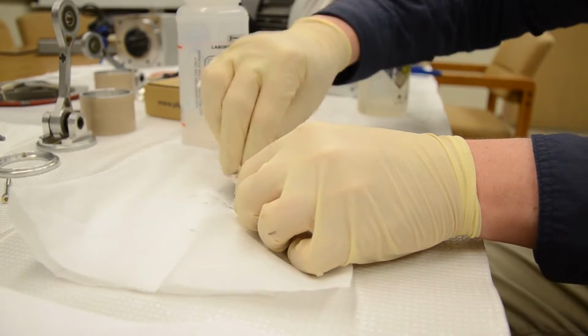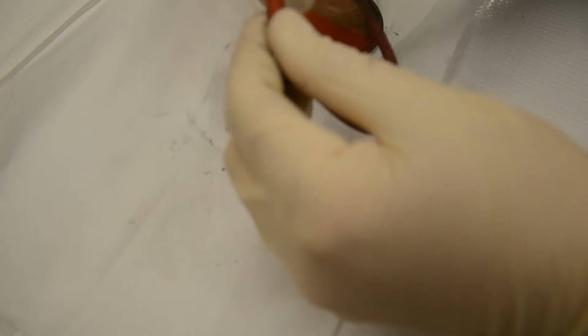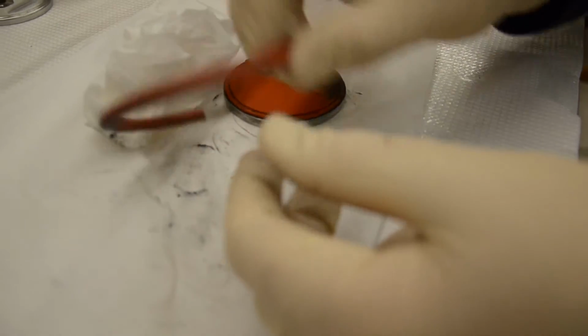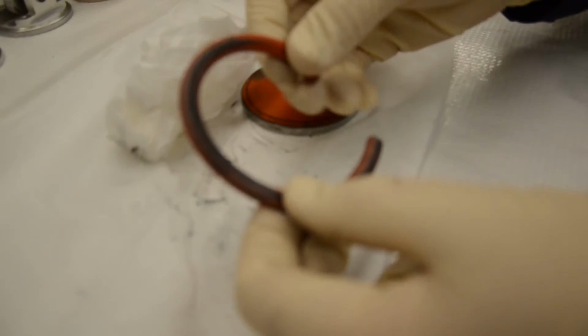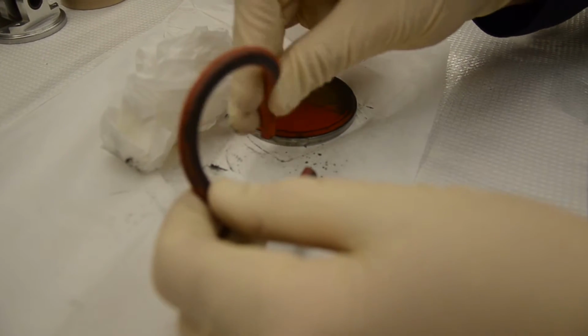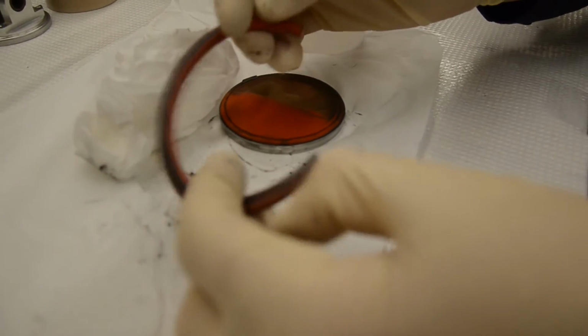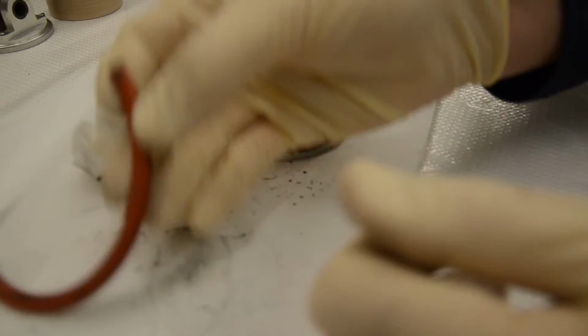So just like before, you'd take some alcohol and try to clean it up. Now this particular, so that's kind of what it looks like, nice and clean. Well, we're getting there. So now this particular hose has been rather flattened, and that's once again because of its age and use, also kind of showing some age. It might have a little bit of life left in it compared to some of the others I've seen that are basically breaking apart. Wow, there seems to be some junk inside too when I twist it like this. In any case, we'll probably save this piece as an emergency spare part, but in many cases when they are being replaced, they're already at the end of their life.